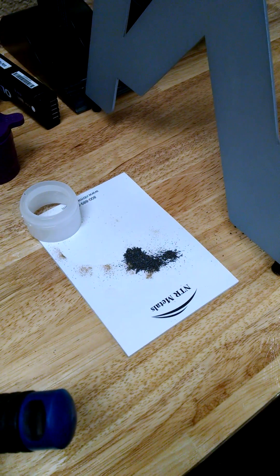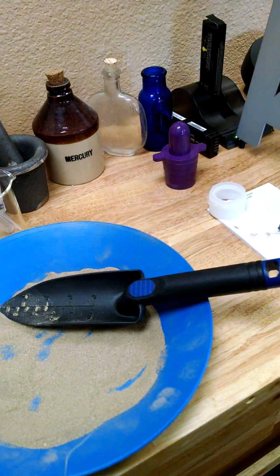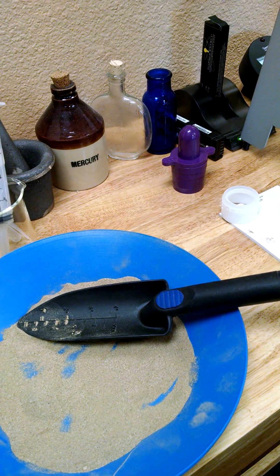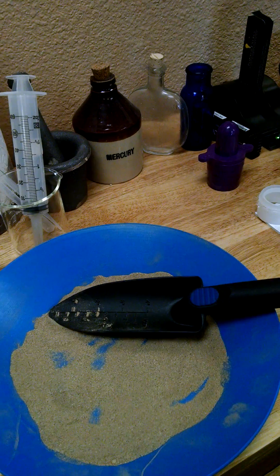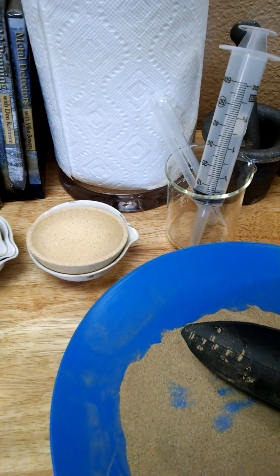I cheated just a little bit — I pulled out some of the iron with a magnet. Iron can kind of mask smaller amounts of gold. Normally when I'm doing a sample for a client, for a mining company or a prospector, I won't pull anything out. I'll just analyze it after we prepare it.